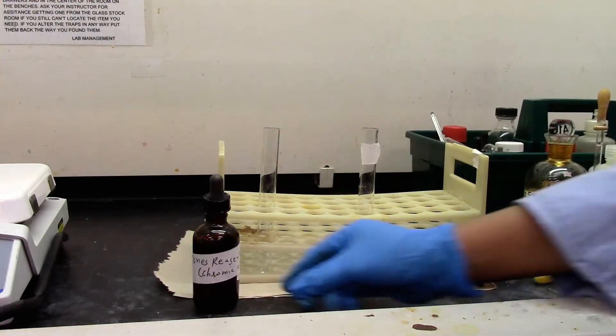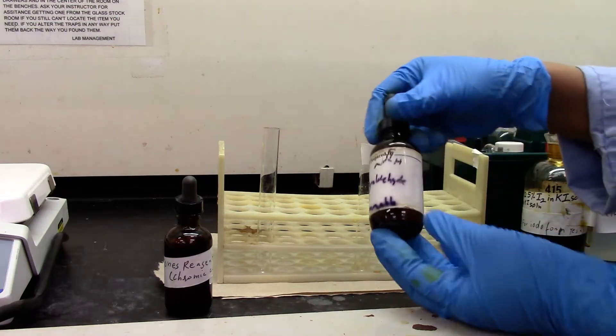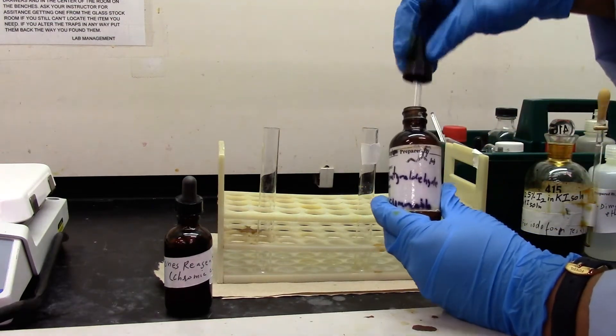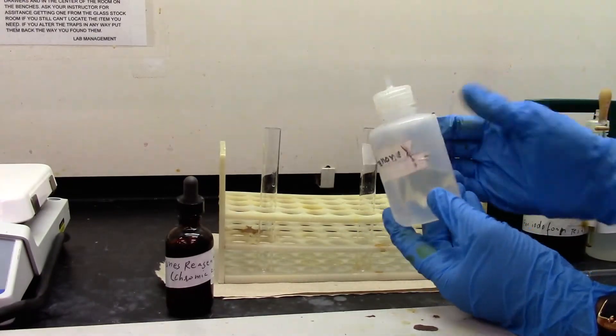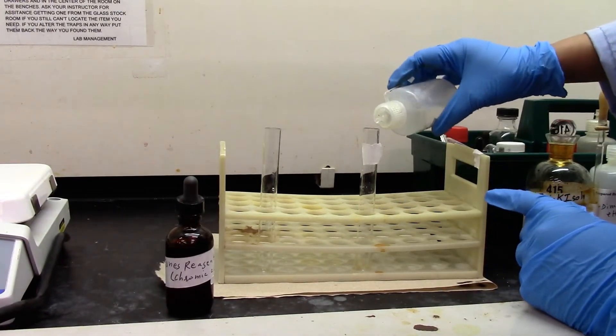We will try Jones test for aldehyde. It's my butyraldehyde as my aldehyde sample.